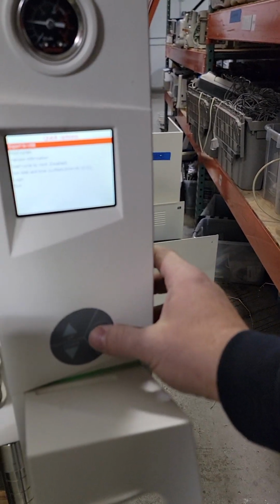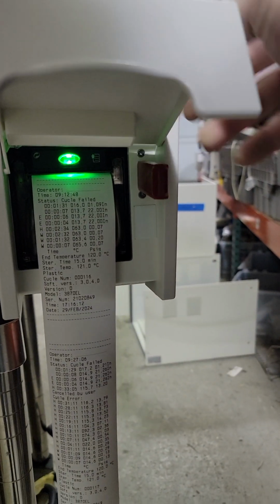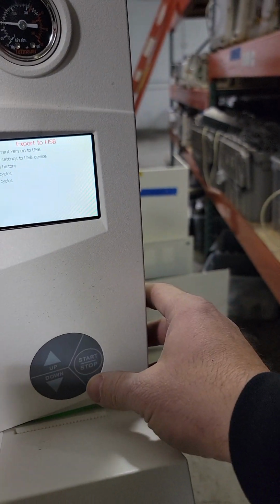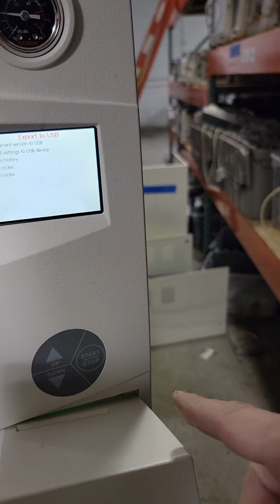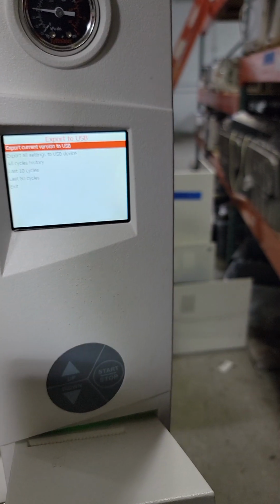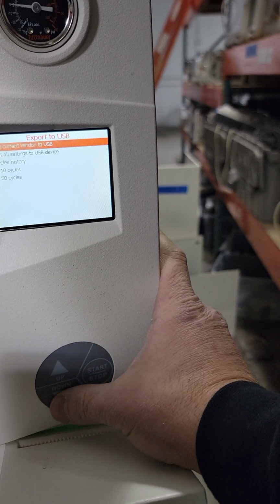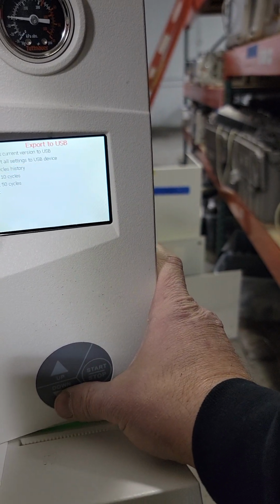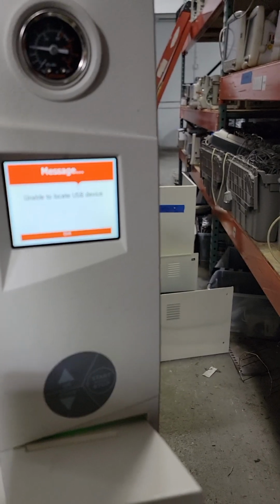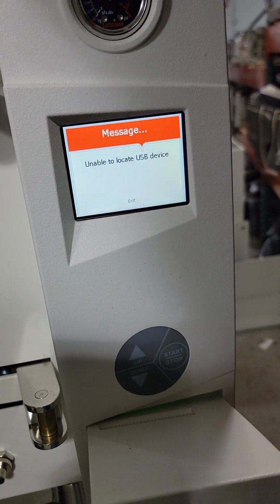Export to USB. The USB is installed down in the printer. Export. The buttons are a little funky too. Sometimes to select, it's the up. Anyway, put down. Actually, the last 10 cycles. That's great. Can't locate it suddenly. Alright, something's wrong with that USB stick.